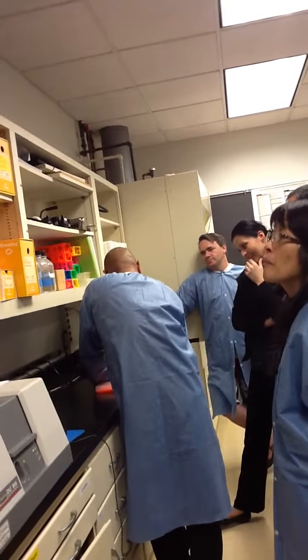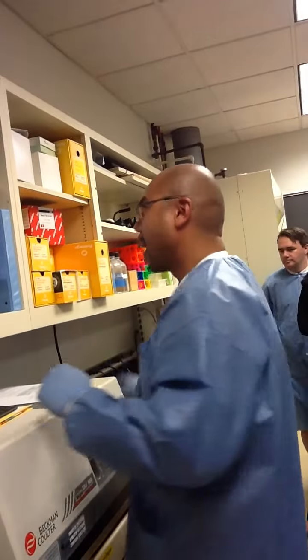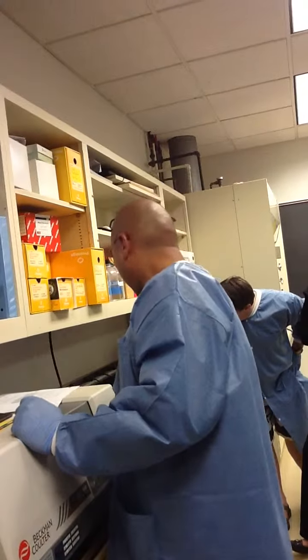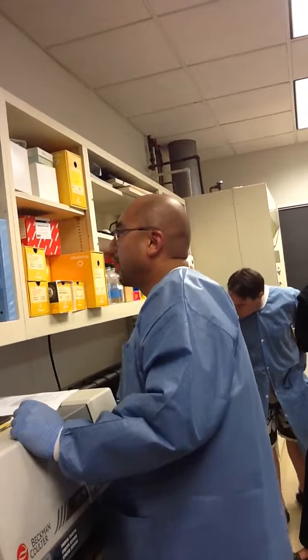Okay, so let's get out of here and I'll show you how to reprogram this. Okay, 1 second. Oops, sorry guys.